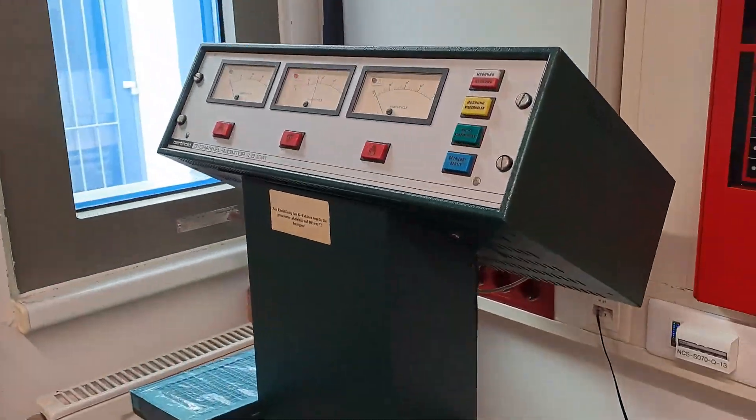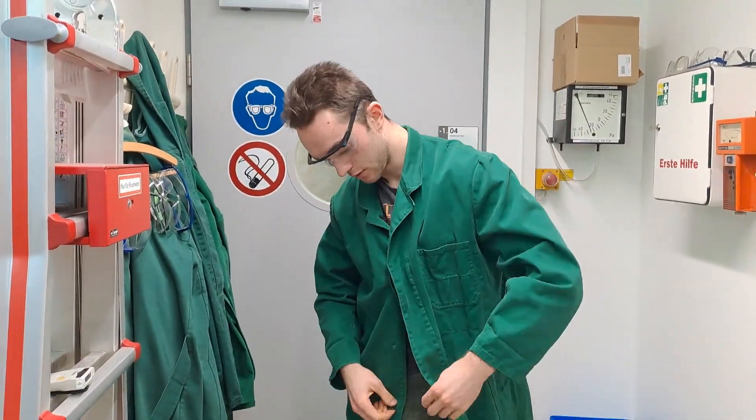Today I'm going to show you some simple chemistry of thorium in its plus 4 oxidation state.